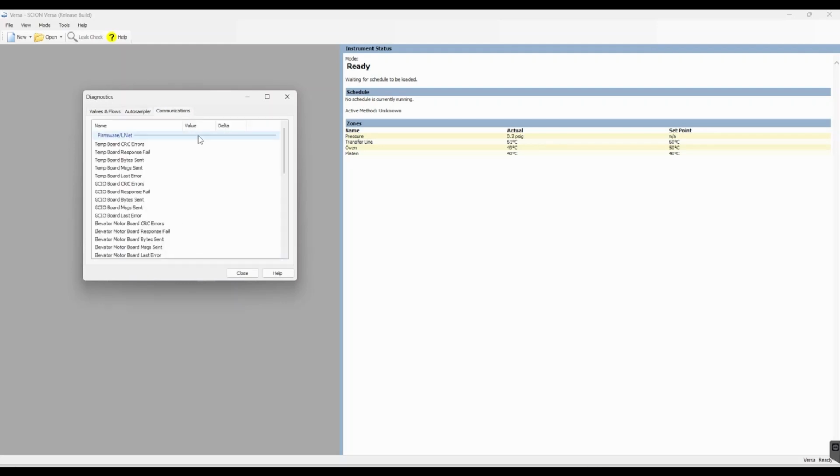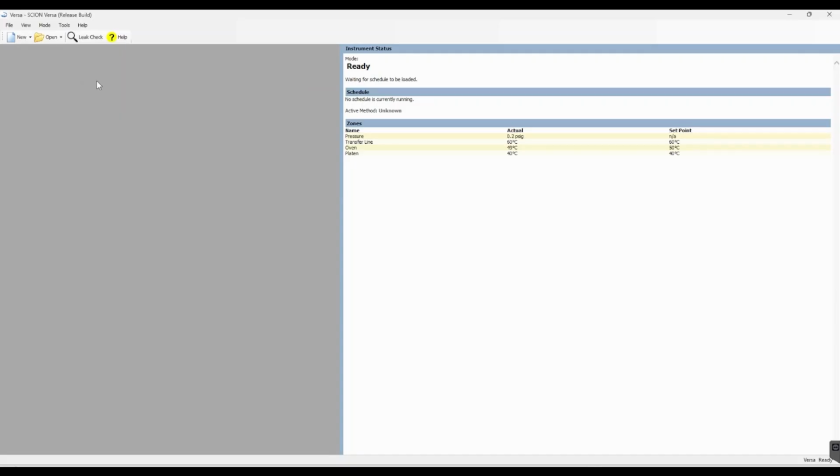Next, we have the communication tab, which again may be most useful for a service engineer, but just to highlight that it is here. Our last tool that we want to highlight here is leak check. So if you believe you do have a leak on your system, that is available within the Versa software. So you can access it through this button or Tools Leak Check.